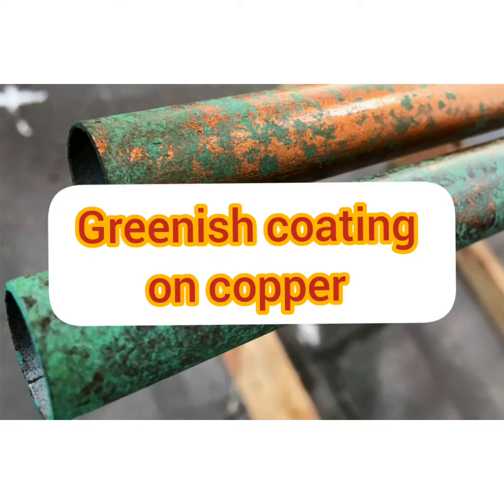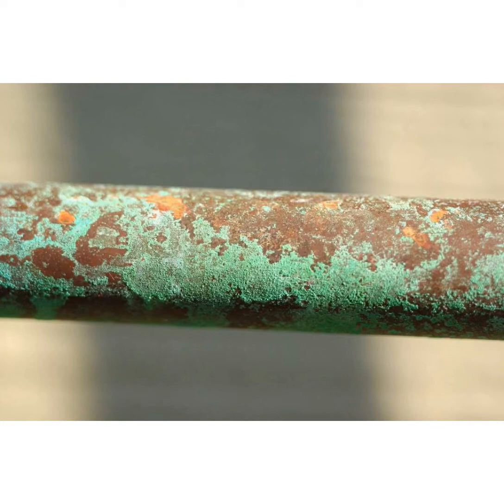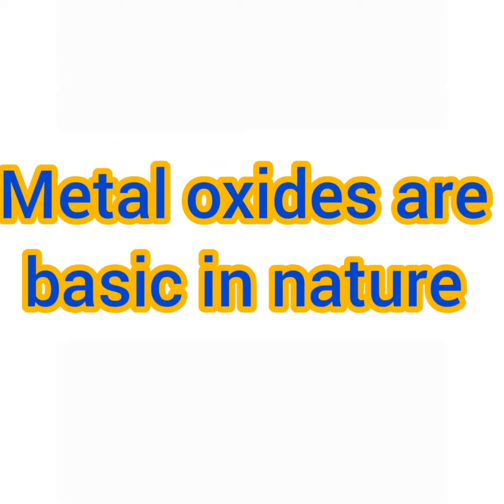Greenish coating on copper. When copper is exposed to atmosphere, it reacts with moist air and forms a dull green coating on its surface. The green material is a mixture of copper hydroxide and copper carbonate. This also we can test with red litmus paper. We can see that red litmus paper turns blue in color. From all these activities, we can understand that metal oxides are basic in nature.